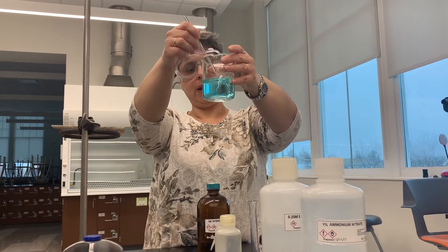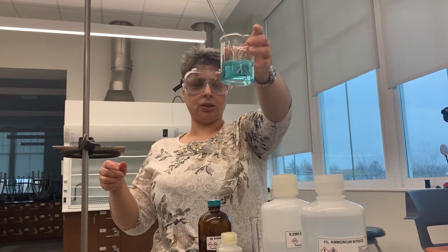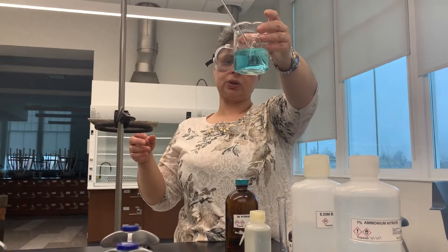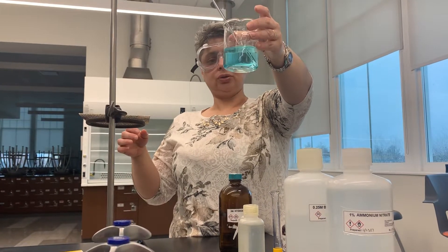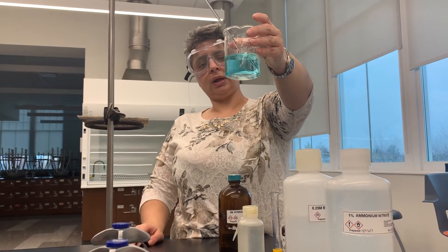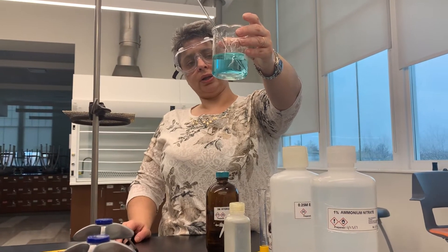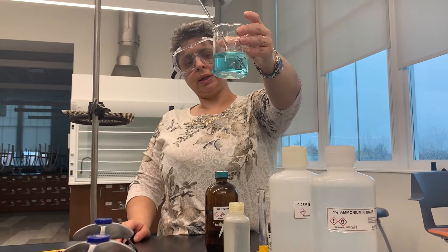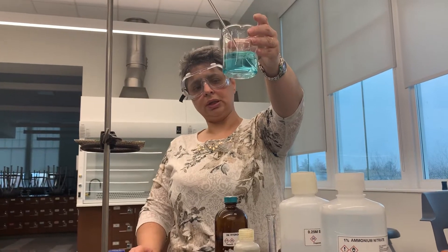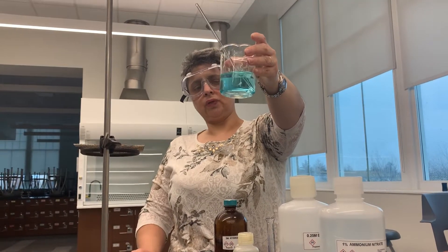I'm going to stir it up and make sure there is no solid remaining. As you can see, the solution is absolutely clear. I'd like to remind you that clear does not necessarily mean colorless. In this case the solution is colored — it's light blue — but it's clear, meaning we are able to see through it. That means the solid has dissolved completely.